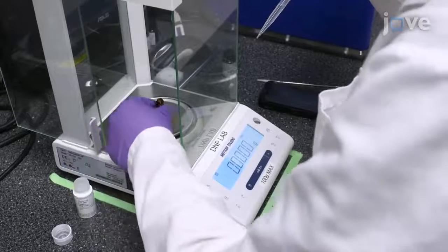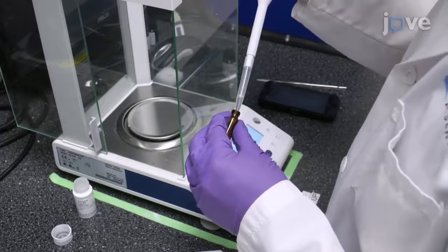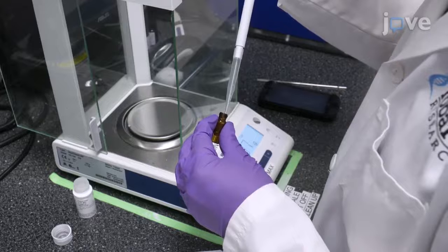Prepare 1 milliliter of stock carbon-13 enriched pyruvic acid solution, widely used for in vivo research, consisting of 15 millimoles per liter of triaryl methyl radical dissolved in 1-13C pyruvic acid.